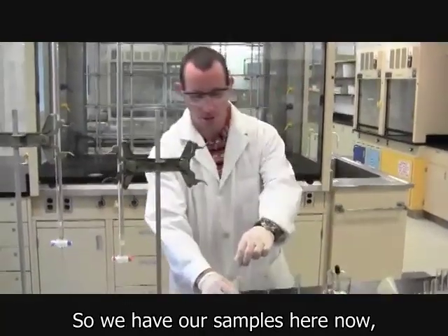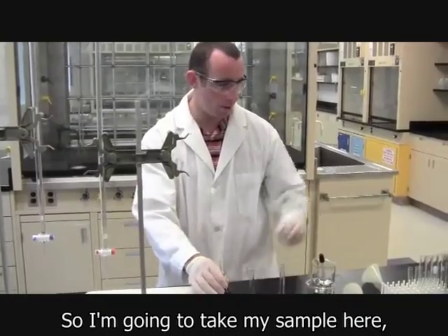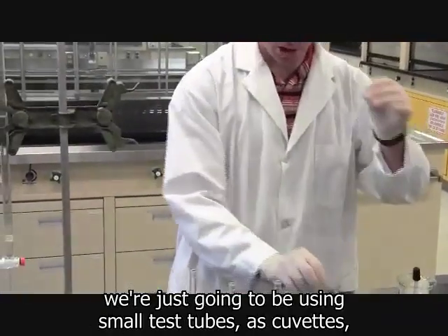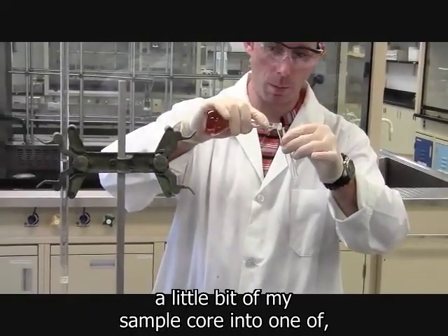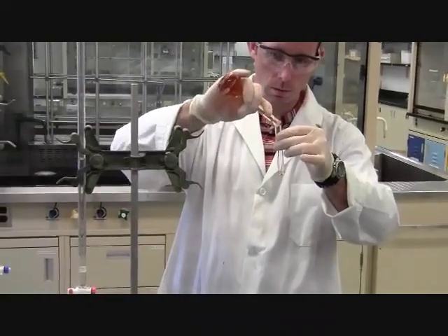So we have our samples here now. What we want to do is measure the absorbance of them. So I'm going to take my sample here. We're just going to be using small test tubes as cuvettes, a cuvette being the medium by which we're going to measure it. So I'm going to take a little bit of my sample and pour it into one of the little test tubes.